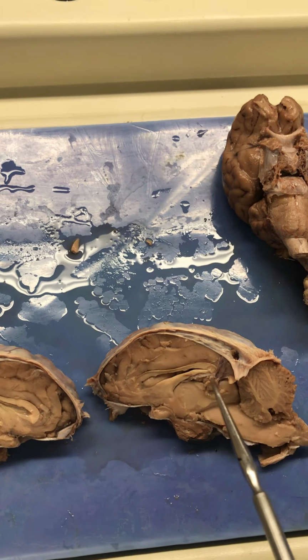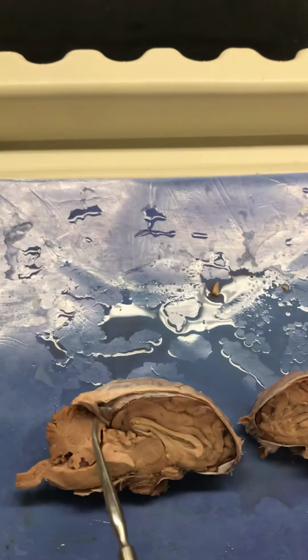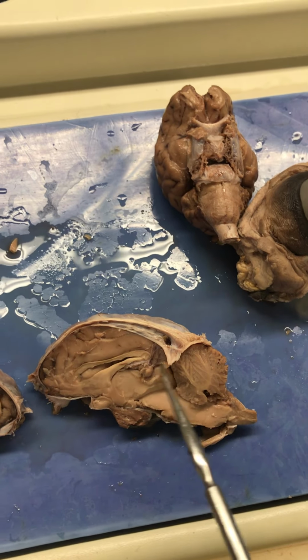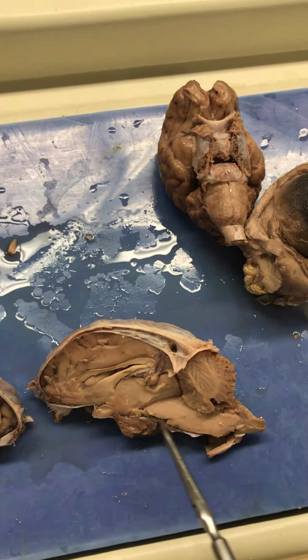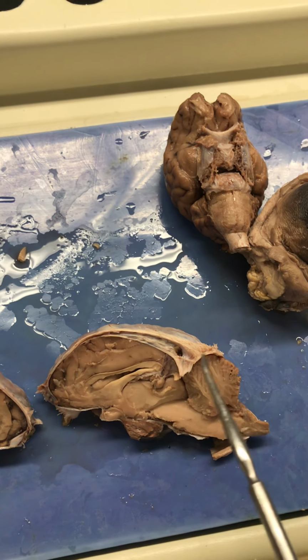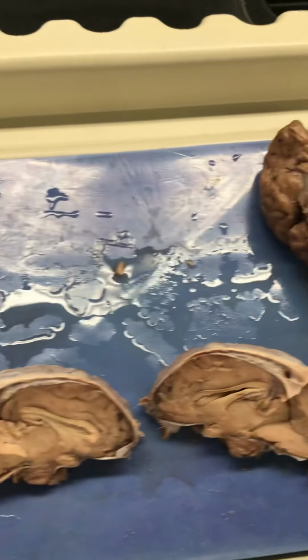This is where that epithalamus was. Beautiful. And then this is a pretty midbrain. Ugh, this one's pretty. So that's the corpora quadrigemina. So that's the superior colliculus, inferior colliculus, and then of course the rest of the midbrain. Pons, medulla oblongata, spinal cord, cerebellum, arbor vitae. And I believe that's about it. So good luck.